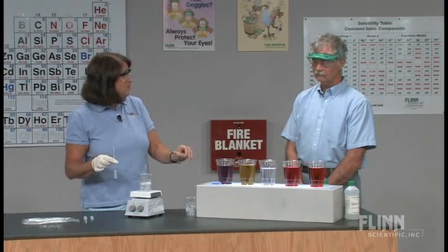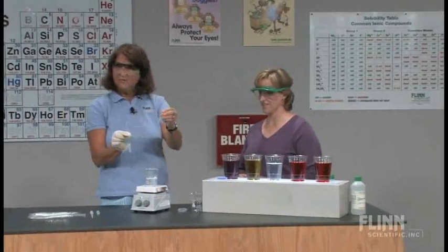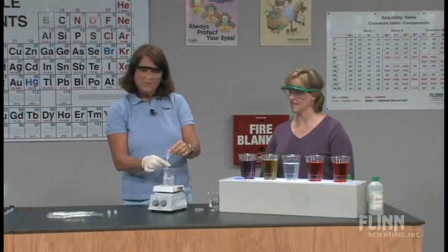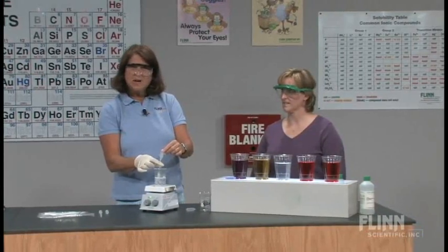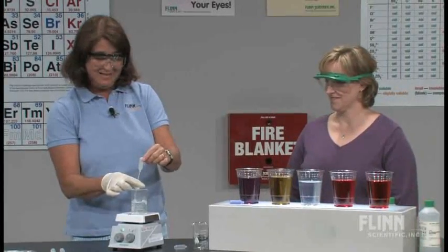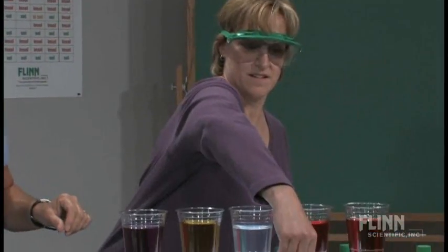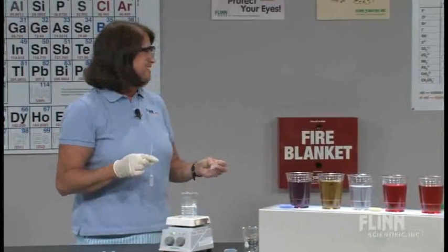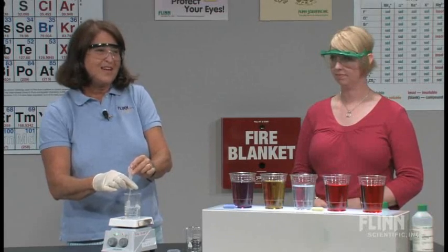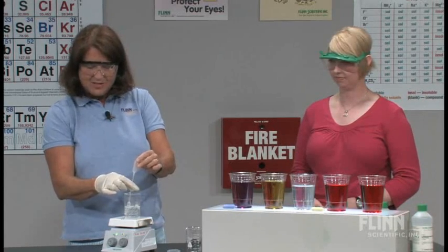We're going to talk about what indicator we've been using. Liz, we're going to have you come up next. Same thing here — ammonia. The tip of the pipette goes into the super jumbo bulb. I take the pipette with the ammonia out of the hot water while I'm waiting. I really don't smell a lot of ammonia gas here, and you know that the ammonia is easily detected. When my students can get involved in the activity, they're paying more attention. They like to watch their classmates, too. So I feel like I'm getting more student involvement, and students are thinking about what's going on here.